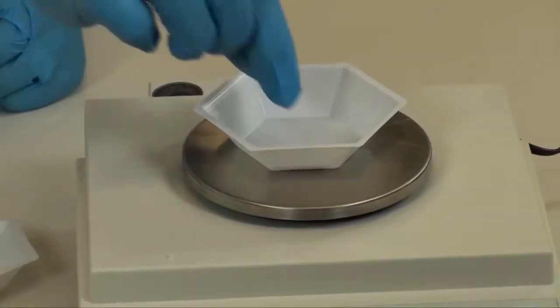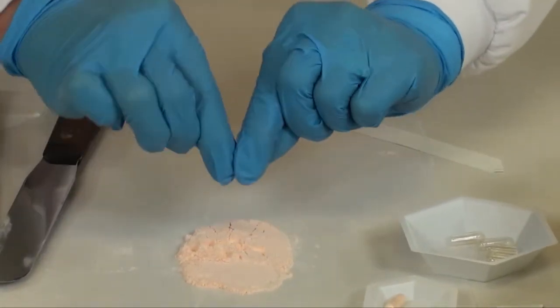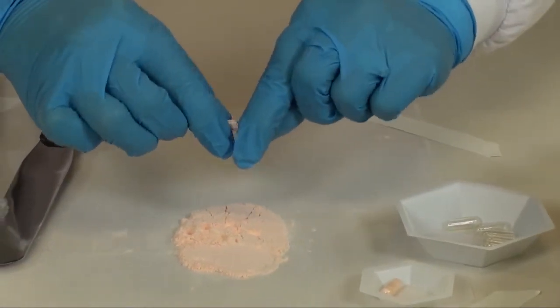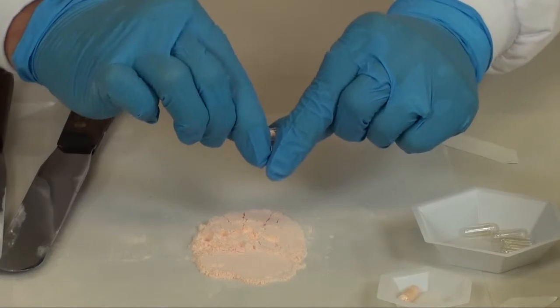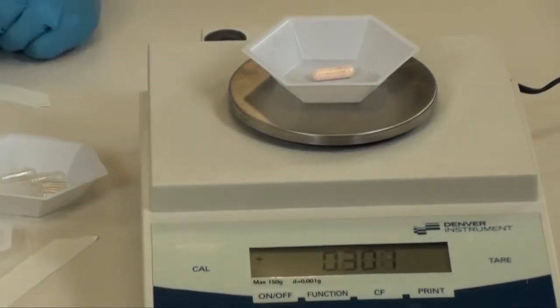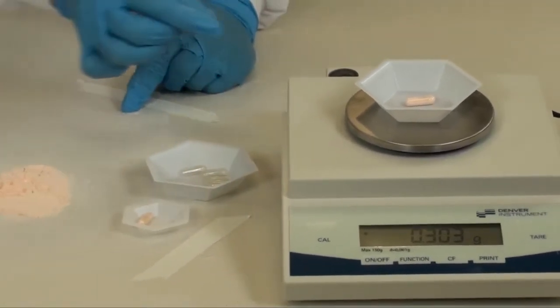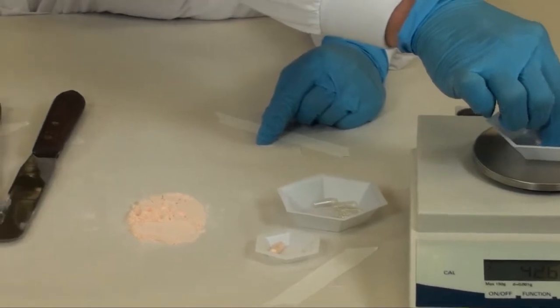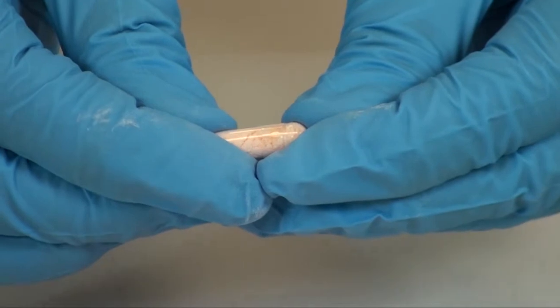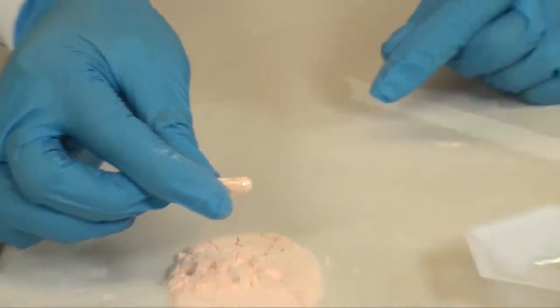Once you get within 5% of your target weight, remove the cap and add just a little bit more additional powder. We are now at target weight, so we can close this capsule. Remember to push it together until you feel the click. It is now ready to be dispensed.